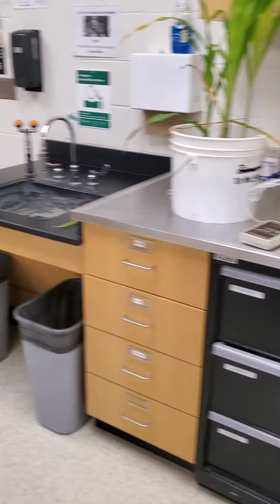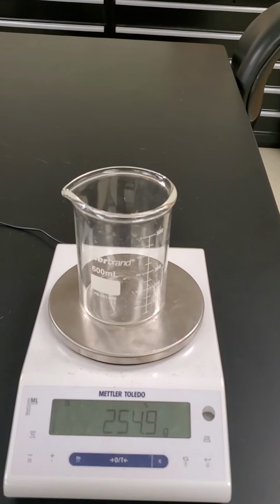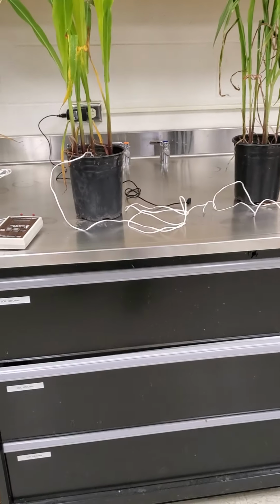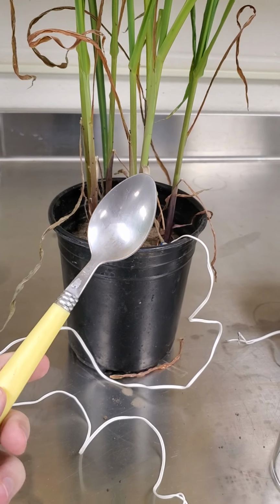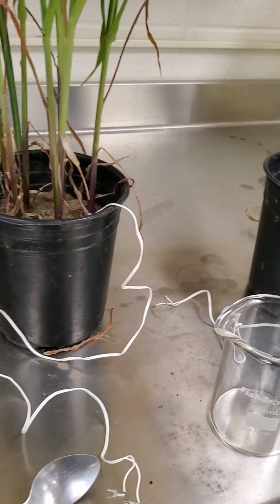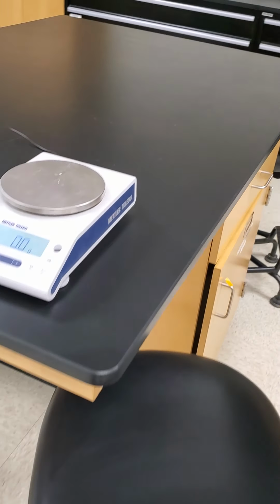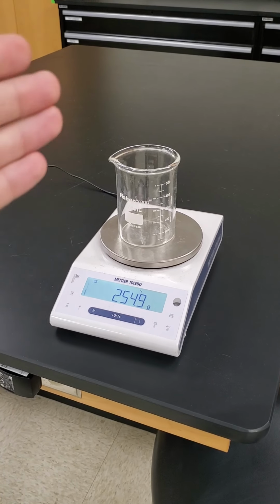To do that, we need to actually measure the weights of a certain soil sample. Over here, I've got a scale with just one of the beakers. Got the weight of that. I'm going to take a sample of soil from these pots just with the spoon. Doesn't matter how much I put in. The starting weight doesn't matter. You're looking at a difference. So I'll just spoon it out, put the soil into the beaker, and then reweigh the beaker with the wet soil. So reweigh the beaker, soil, and water.